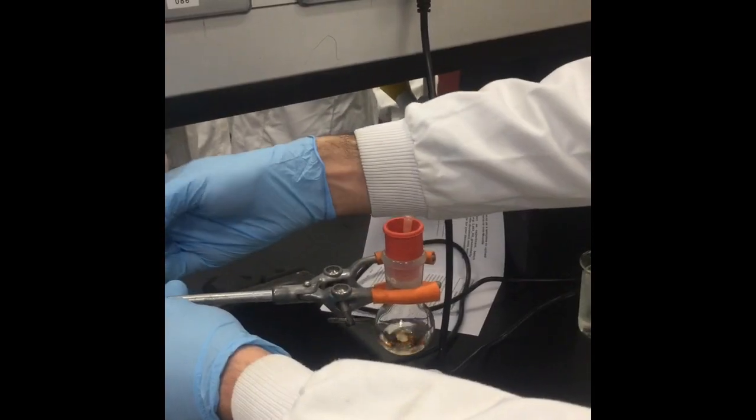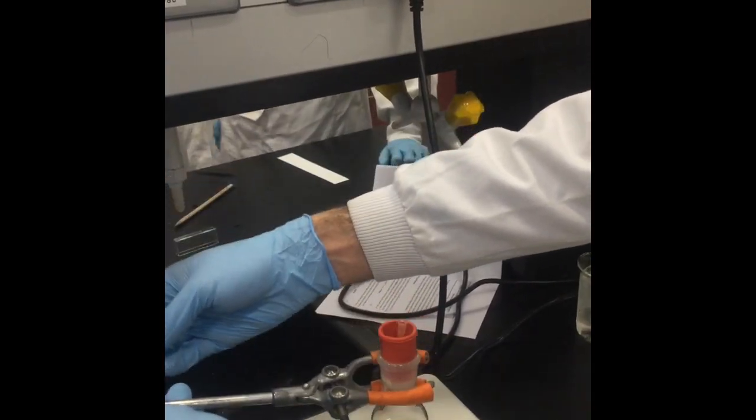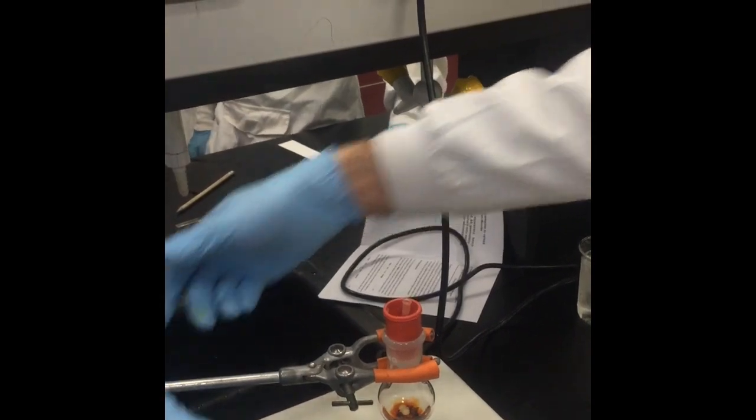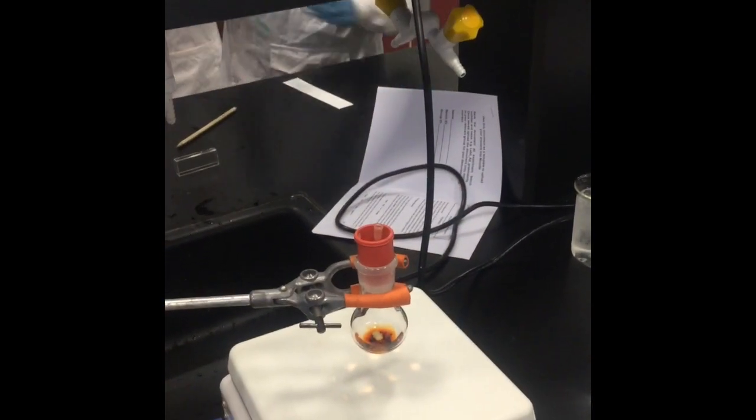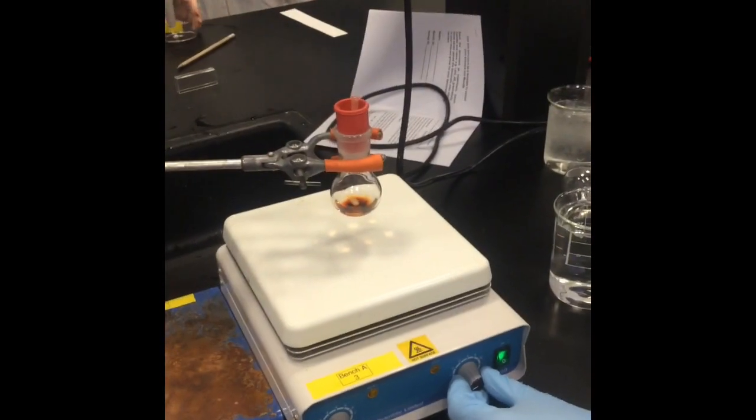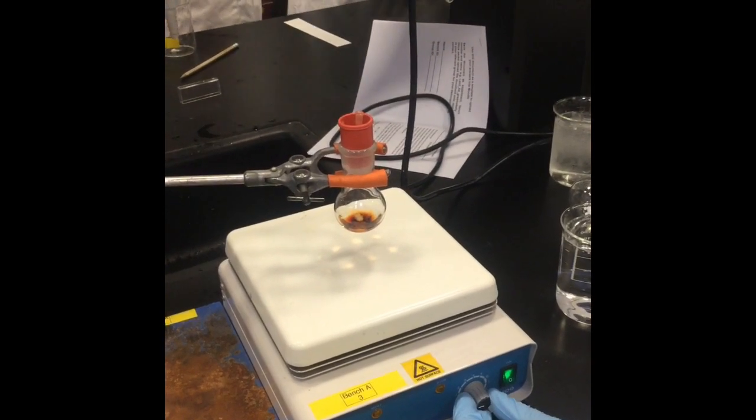Lower the reaction onto the stirring plate but very carefully start the stirring, noting that the stirring bar is moving ever so gently. The slow stirring is very important to initiate the reaction.